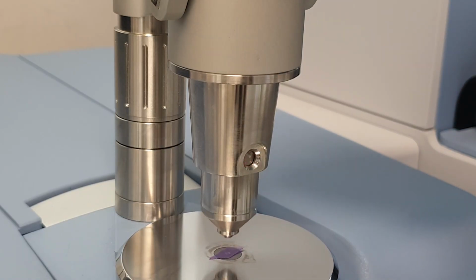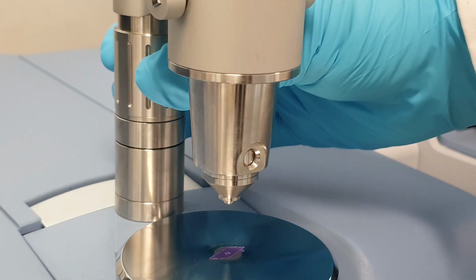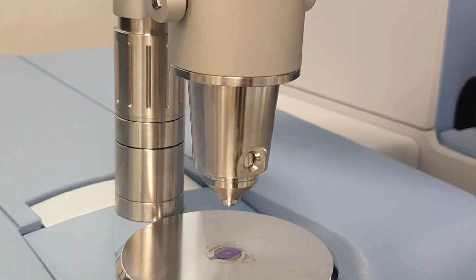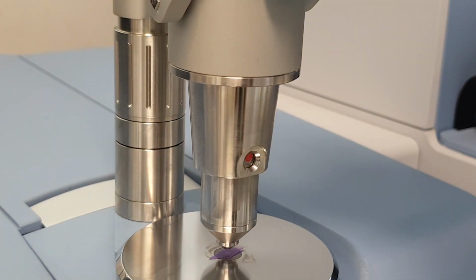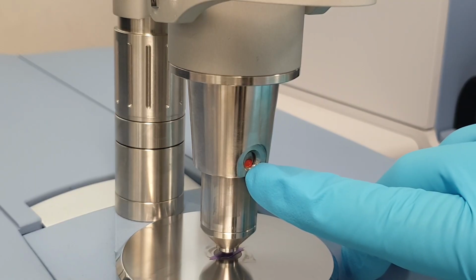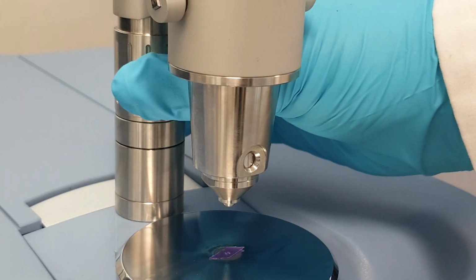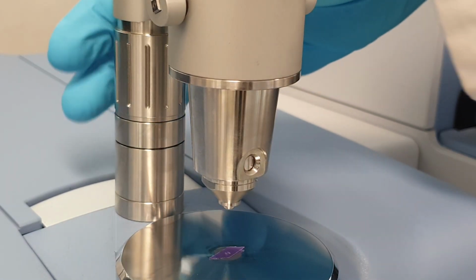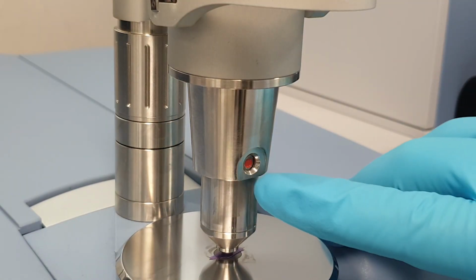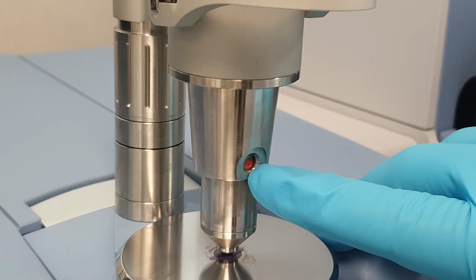So release the anvil from your sample, turn the collar at the back to bring this down towards the sample, just about a quarter of a turn, and then reapply pressure again and see how that impacts the red dot. You want to bring this into the center of the indicator, so I need to increase this a little further. So I go another quarter to a half a turn and then squeeze down again. And now the red dot is in the middle of that circle, indicating optimal pressure.